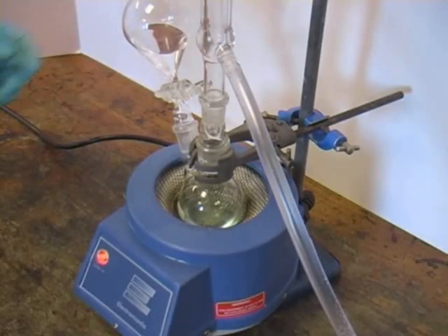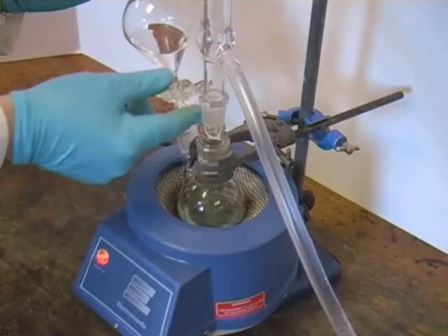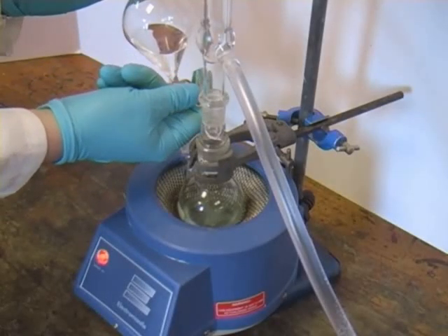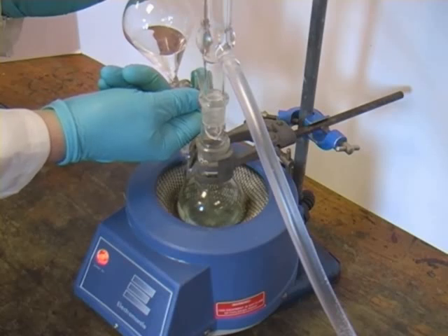With the reaction refluxing at a steady rate, we're now ready to add some of the reagent solution from the dropping funnel. We do this simply by opening the tap on the dropping funnel very carefully to ensure that the reagent is added slowly.